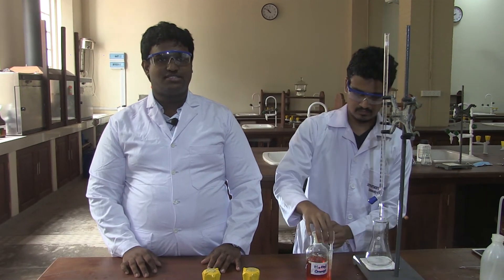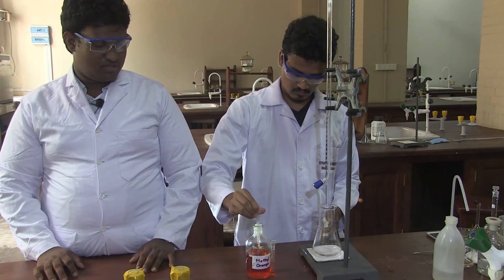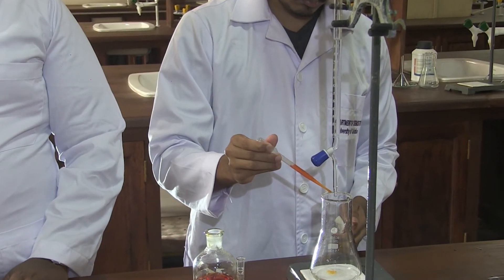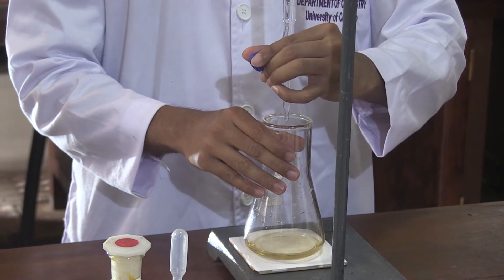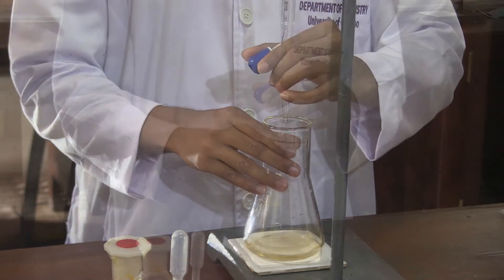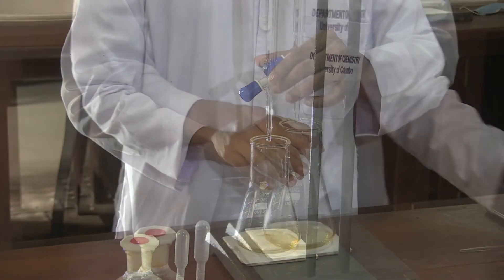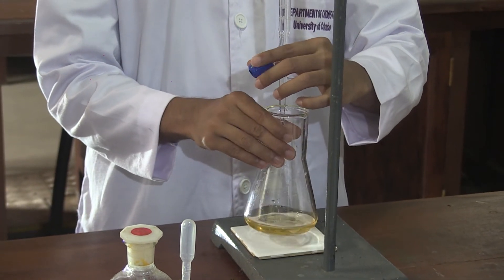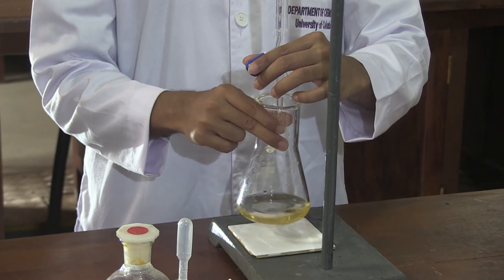take the methyl orange indicator and add two drops into your titration flask. Now start your second titration. You can add methyl orange to the same titration flask, or alternatively use a separate titration flask for adding methyl orange to keep the process clean.